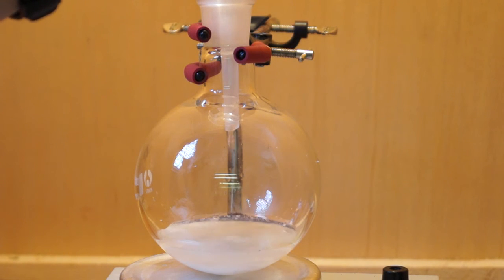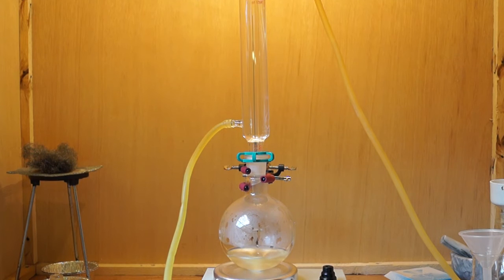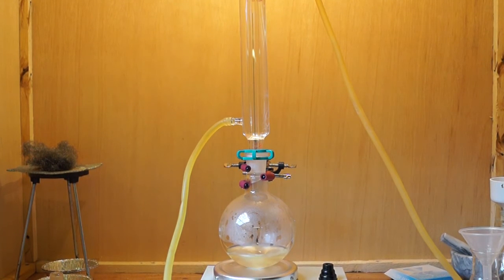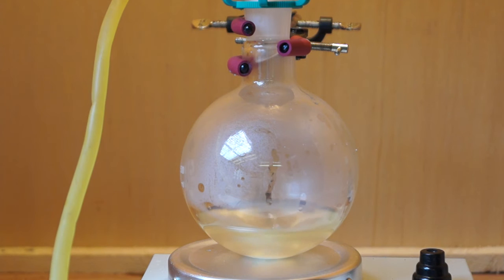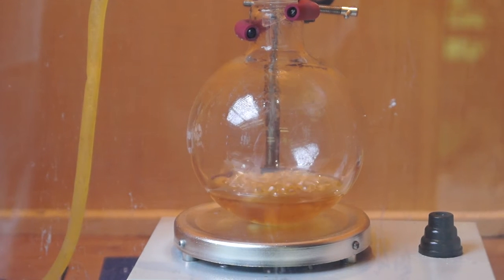I then added the aspirin powder I produced in the first stage to a 500 ml boiling flask, along with sodium hydroxide solution. I then heated the mixture under reflux for about 10 minutes. The solution turns dark orange.